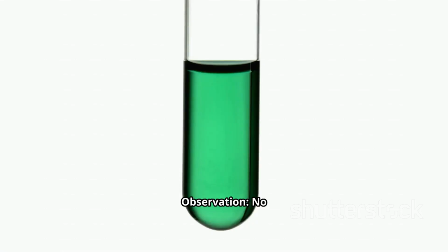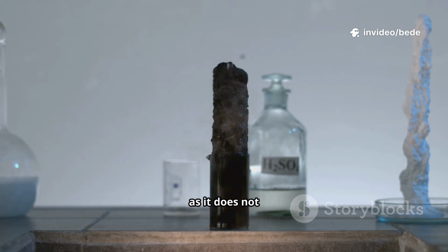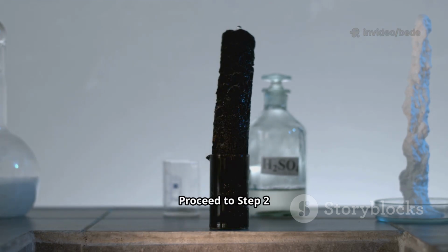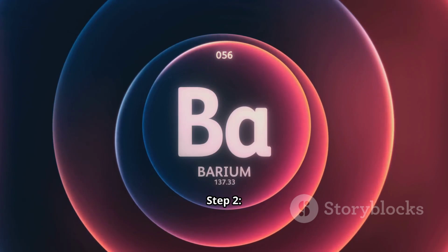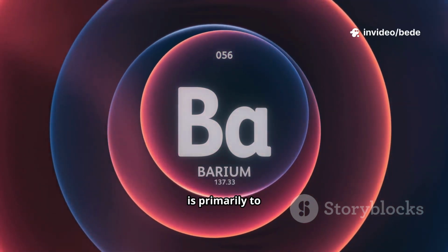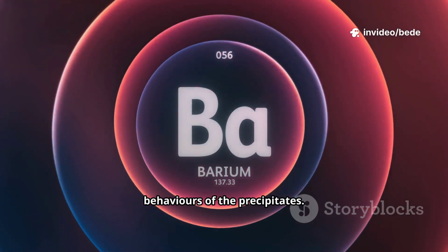3. Observation: no reaction or no gas evolved with dilute acid. Inference: the sulphate ion is likely present, as it does not react with dilute acid to produce a gas. Proceed to step 2 for confirmation. Step 2. Confirmation using barium chloride solution. This step is primarily to confirm sulphate, but it also shows the different behaviors of the precipitates.